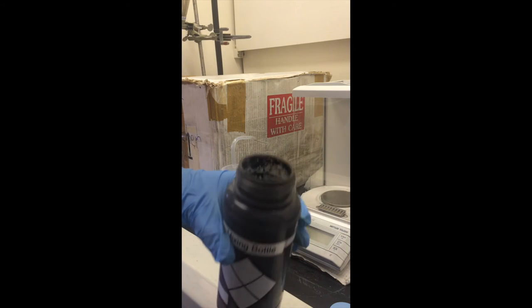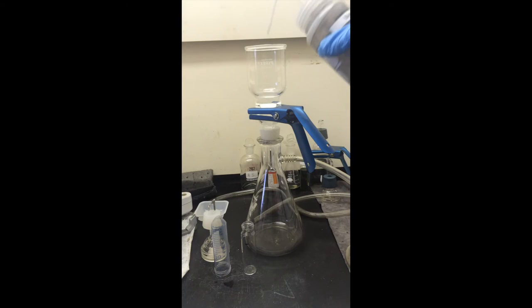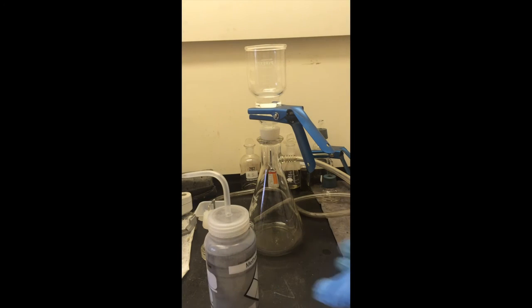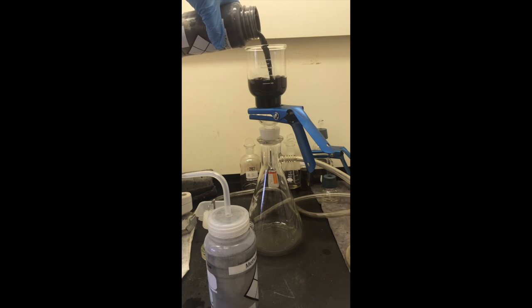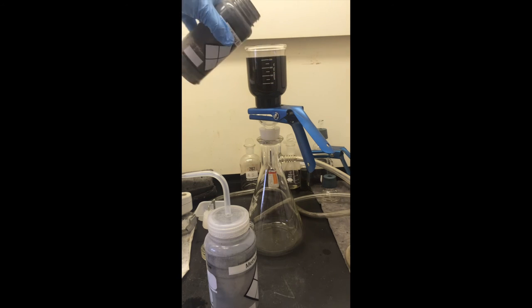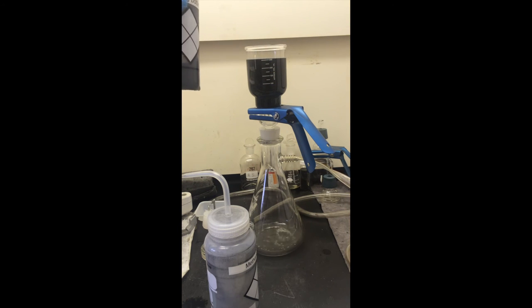The suspension is then removed from sonication. With the vacuum off, the cup and the membrane are wet with methanol, and then the nanotube suspension is added to the cup. The vacuum is applied, and the methanol filters from the suspension, producing the felt.